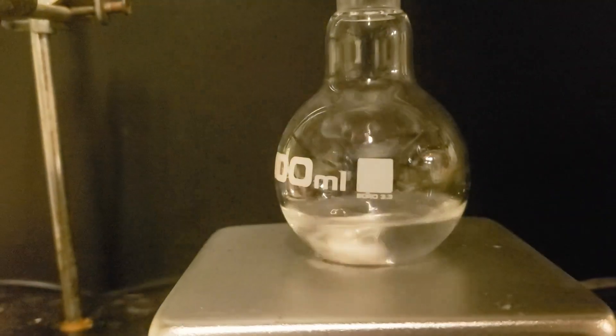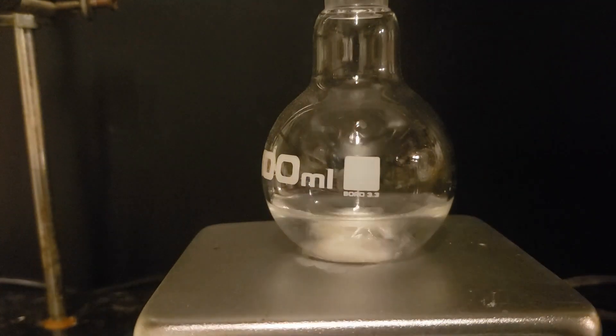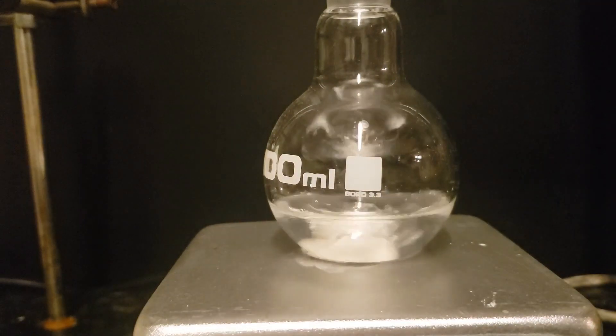Next, 6.64 milliliters of 20% hydrochloric acid is slowly poured in over the course of around a minute. A P1000 micropipettor is used to assist in this.